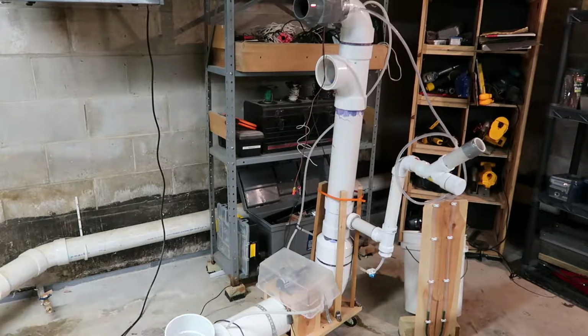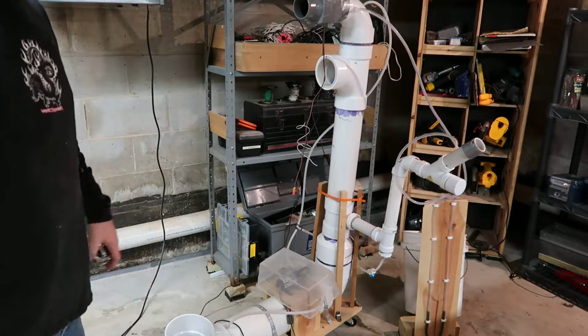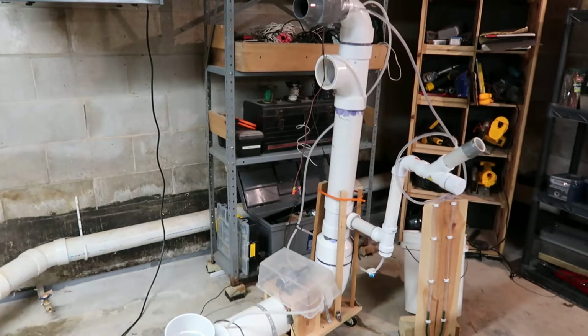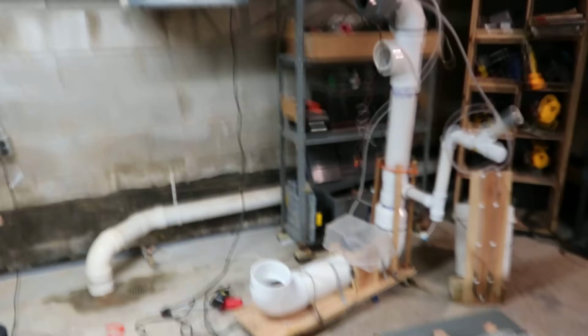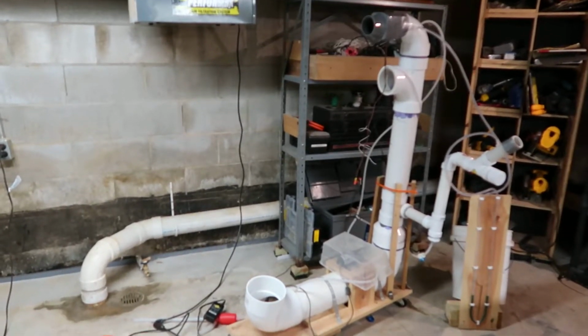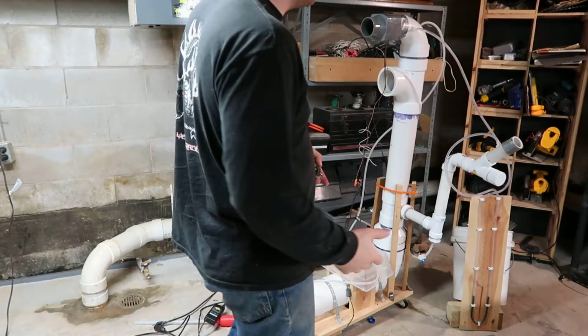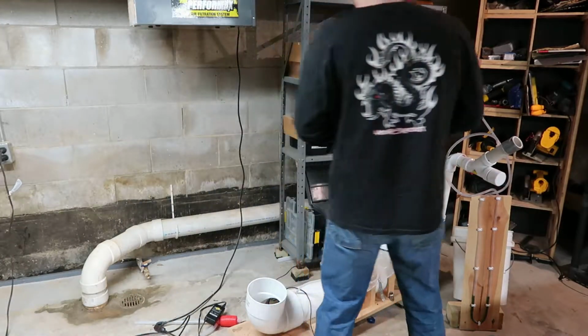So, time to see this thing actually run. A couple more things I wanted to point out before the main event: this piece of equipment here is more or less a proof of concept to show what could be done in the home. Don't take anything here as set in stone. It's just kind of showing the parts that are necessary.